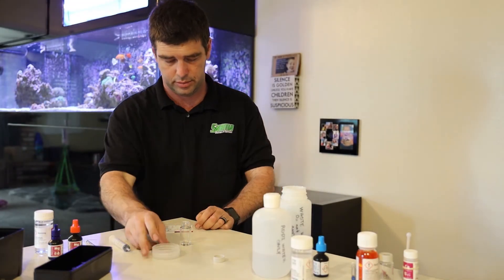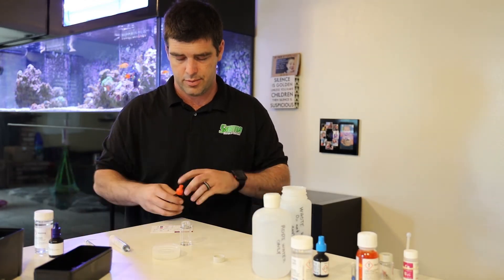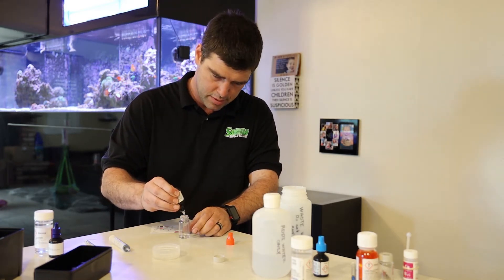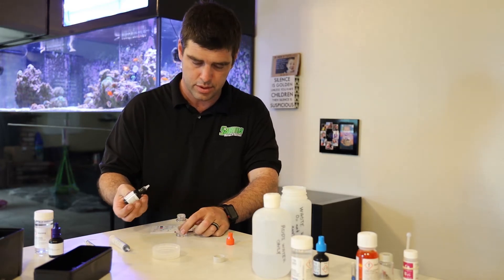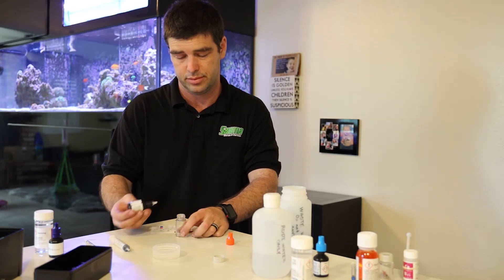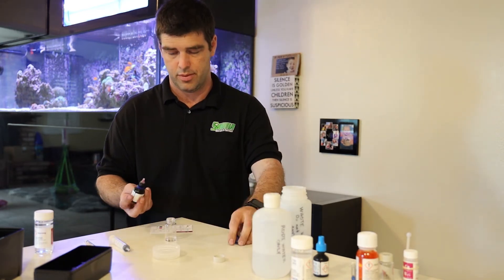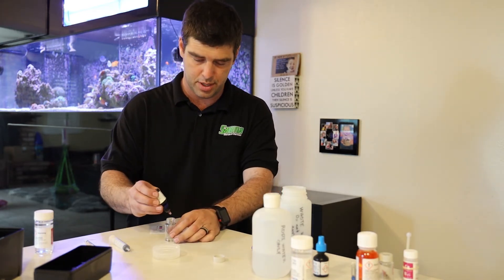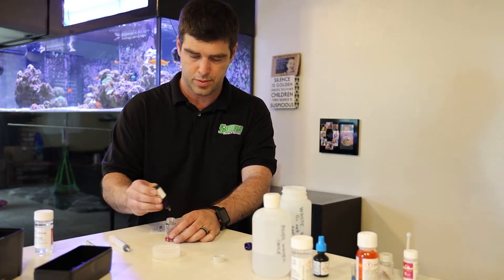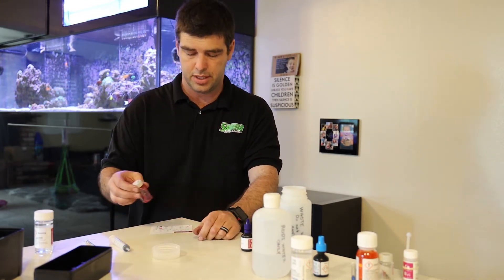Two mils of water. Five drops, non-consecutively — so you put in one, wait 15 seconds. And one moment later, five drops of part B. These ones can be consecutive, and more drops. It says to replace the lid and shake for 60 seconds.